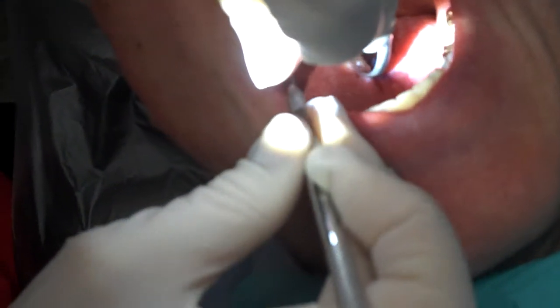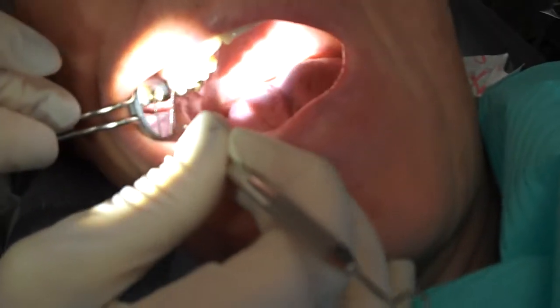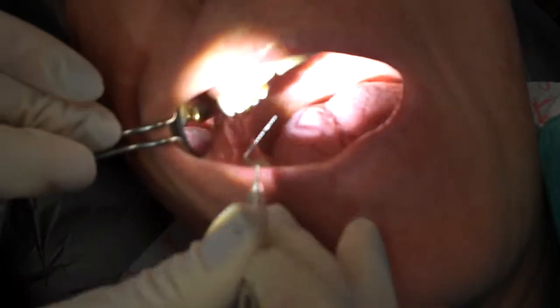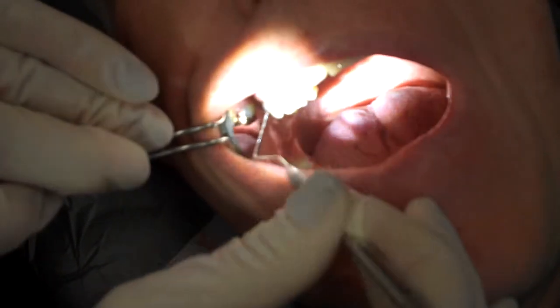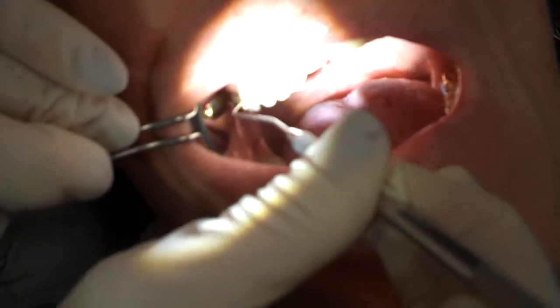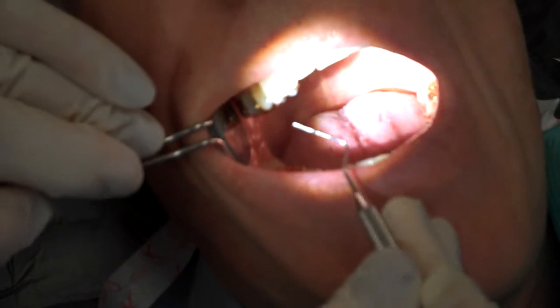This area's a little bit deeper. We'll go in there and just try to tease a little bit of plaque out. No luck there. You want to try to leave it as undisturbed as possible. Now there's bleeding — if there's bleeding, you're going to get a bunch of red blood cells, and that's really not of any diagnostic value. There's a little bit on there, so we'll use that.